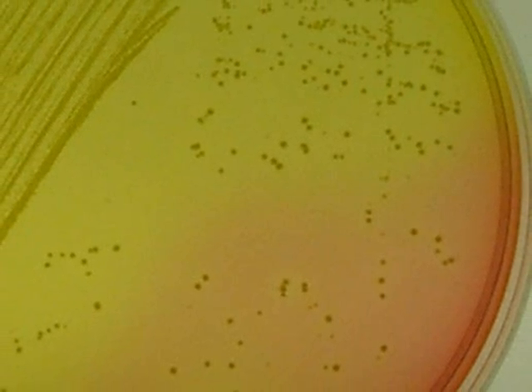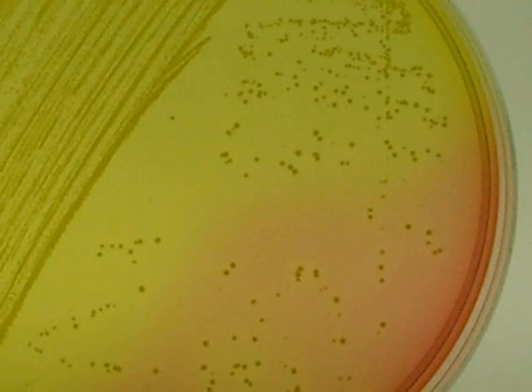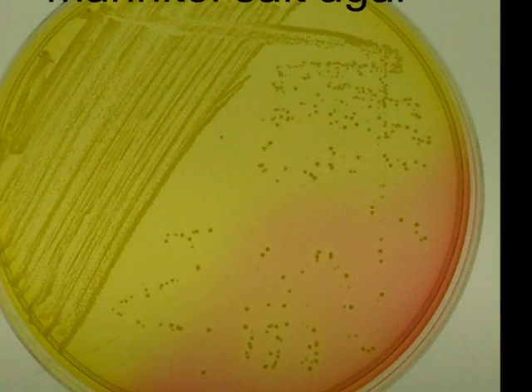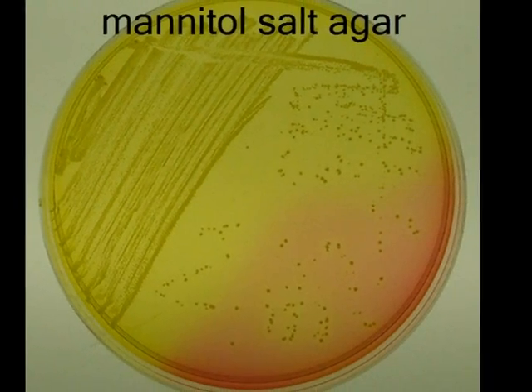In this striking example of mannitol salt agar growth, you can see a dramatic change in the color of the media. Your interpretation would be, the microbe tolerates the salt, it ferments mannitol, and is most likely gram-positive. The most likely identification in this case might be Staphylococcus aureus.